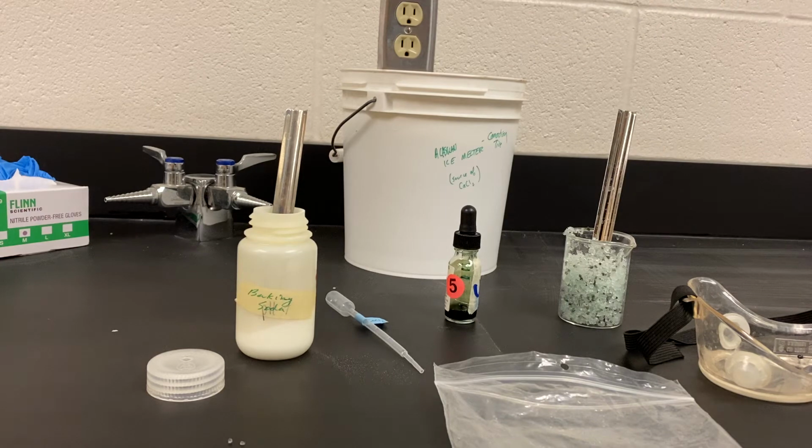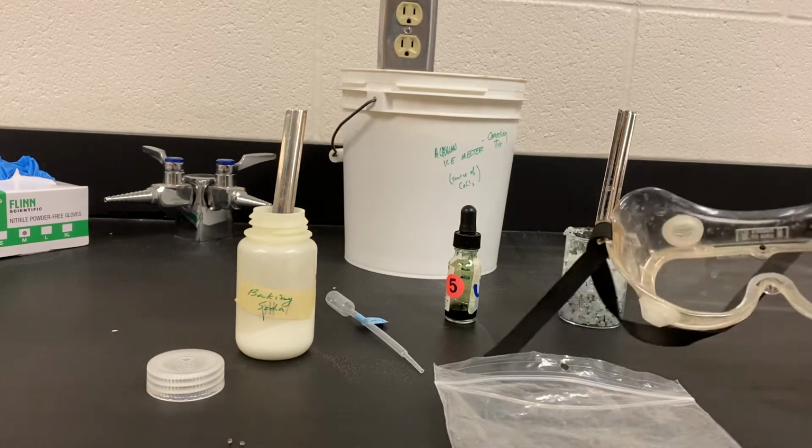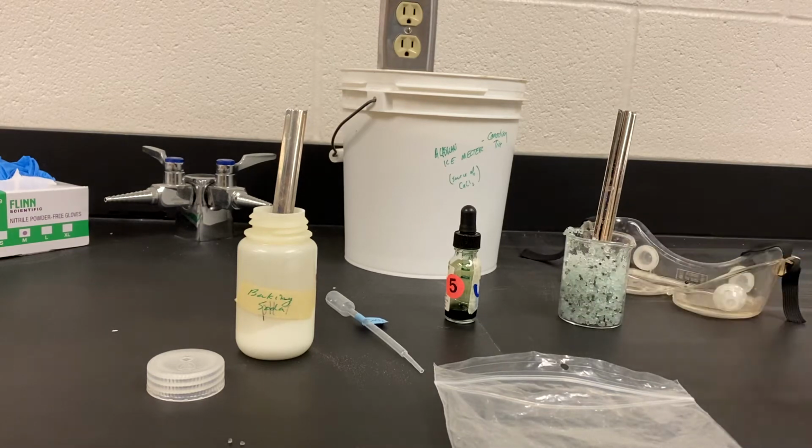You can see that I've been using gloves. I also have my other pair of goggles here. I've got a regular pair on as well, so I just wanted to make sure that I've got my safety in there too. So I've got my gloves and my goggles. And I'm in an area that is well lit and the ventilation is on. I don't know if you can hear that, but ventilation is definitely on.